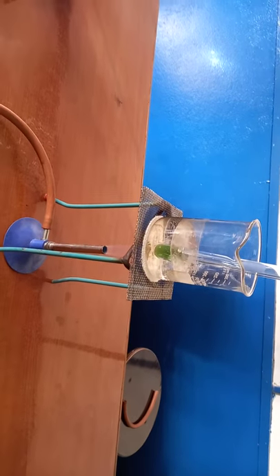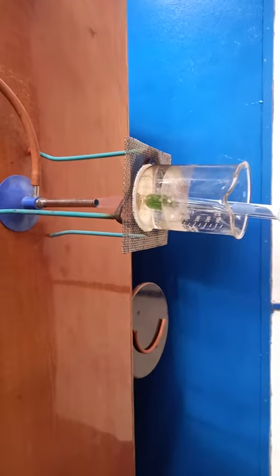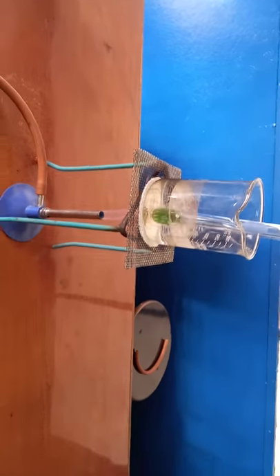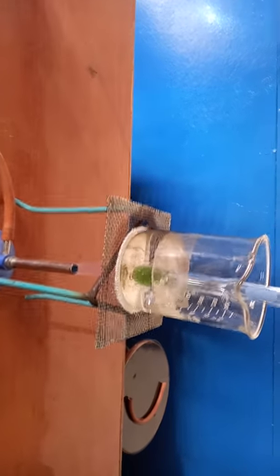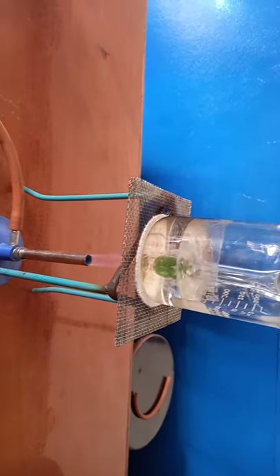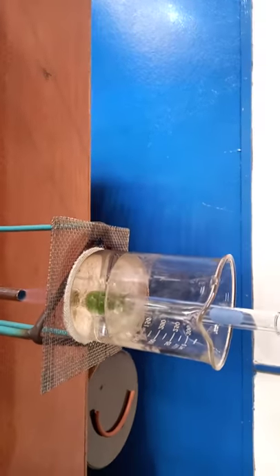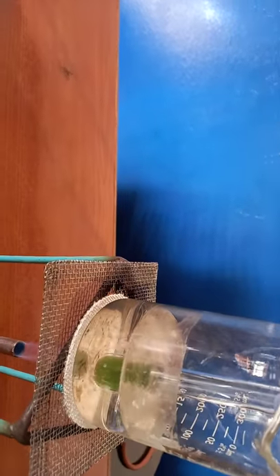Welcome back. Picking up right where the last one left off, we can see that the Benedict's solution has now changed to green.